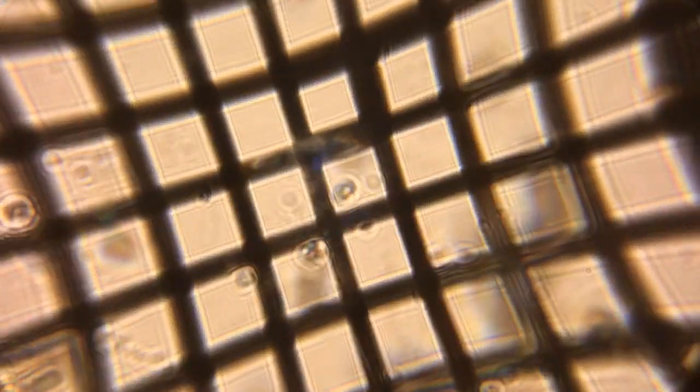You can also mount these right on your cell phone, which is what I've done to take the microscopic pictures in this video, and you treat them exactly the same way. Just tape it over the lens of your cell phone so you can see the screen and then pivot the sample up and down to focus.